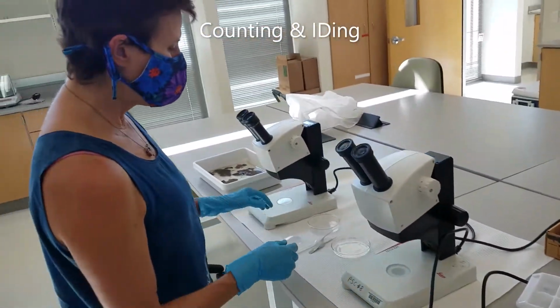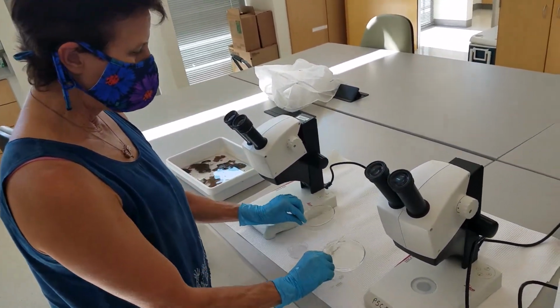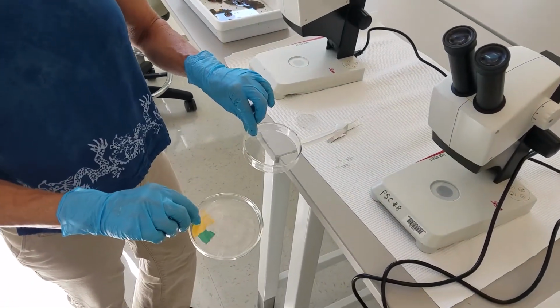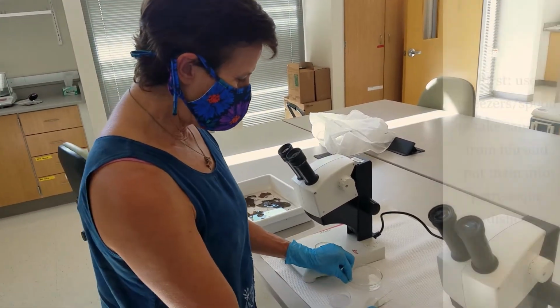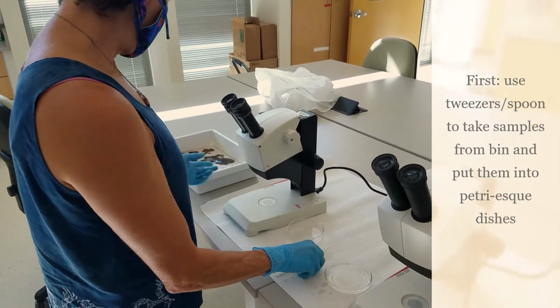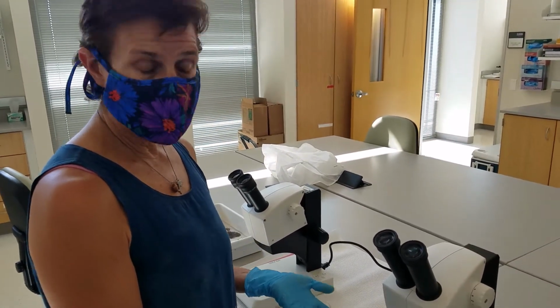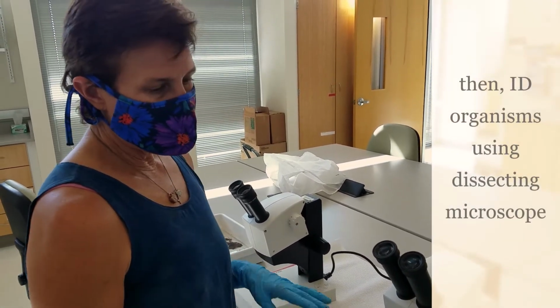I have a couple dissecting scopes here, and so two of us can look at this. Then we put the samples in these little Petri dishes, and we can use a spoon or tweezers to take things out, and then we'll look at the creatures under the dissecting scopes and ID them.